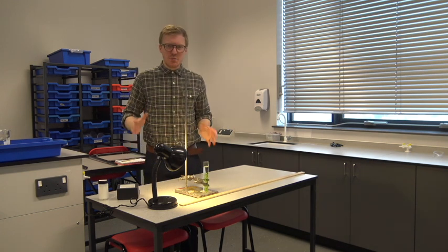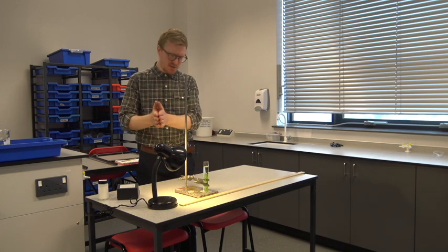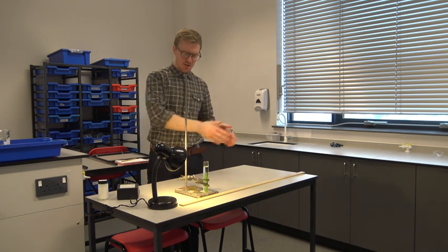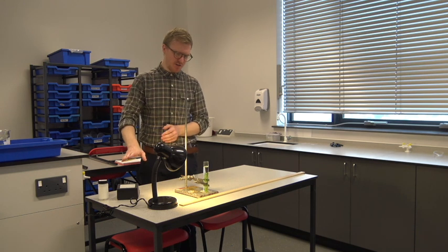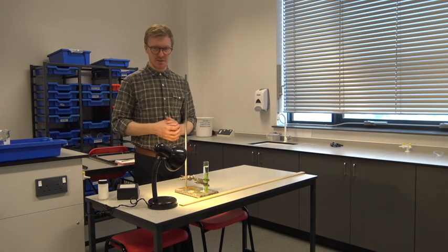So now we're going to move the pondweed another 20 centimeters away from the light source. And actually I'm going to do that multiple times and then we're going to repeat the process and then see how the rate changes as we get further and further away.